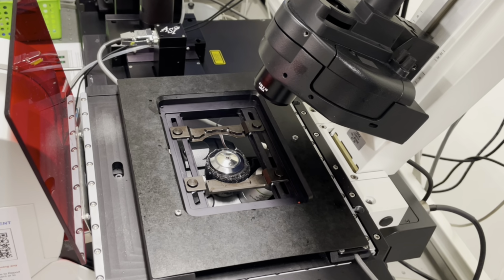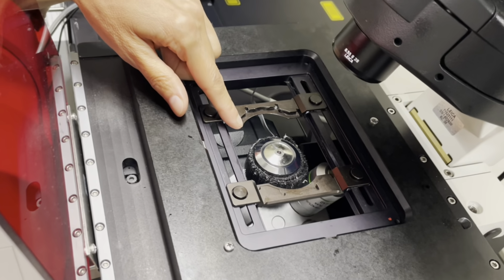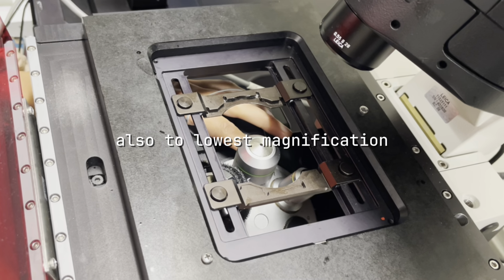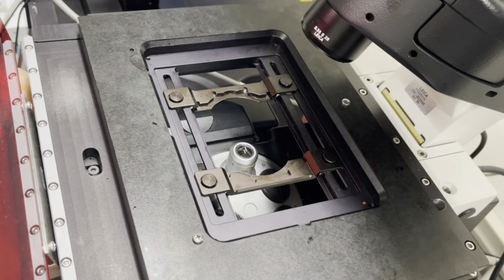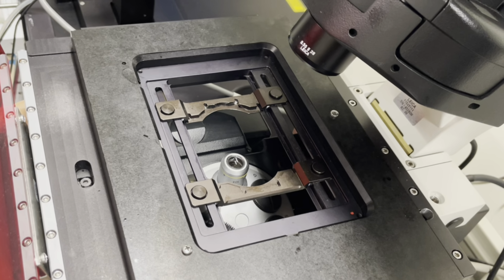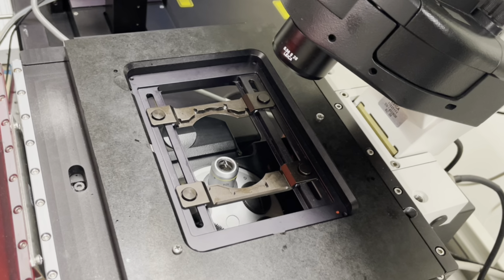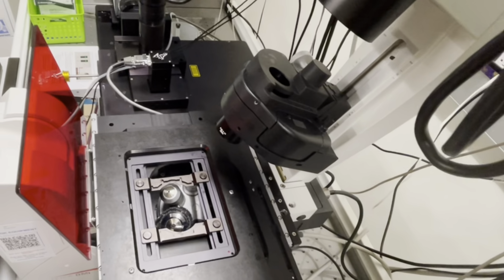Once you've removed your sample and cleaned the lens, you'll want to move the lens downward to the lowest position. You should also move to the lowest magnification. On this system, we're doing it manually because it's not automatic, but most will move when you switch them on the computer. Also, make sure the stage is centered.